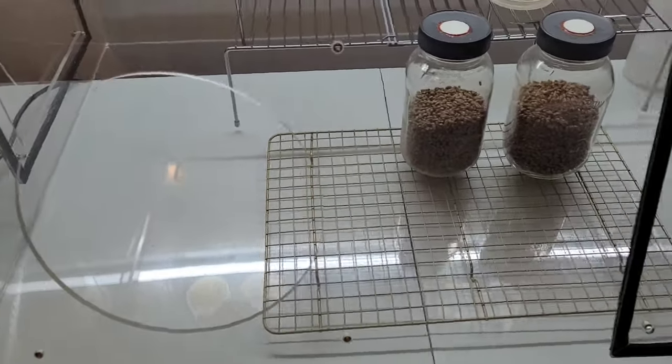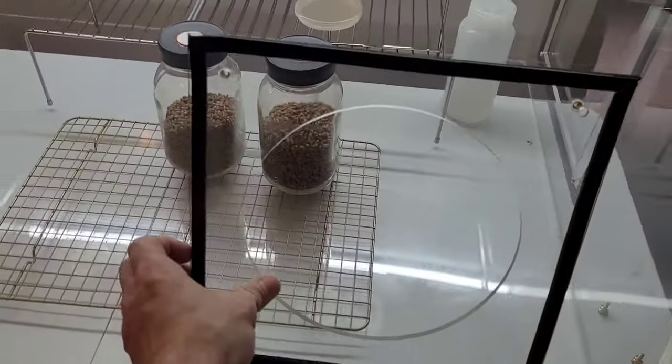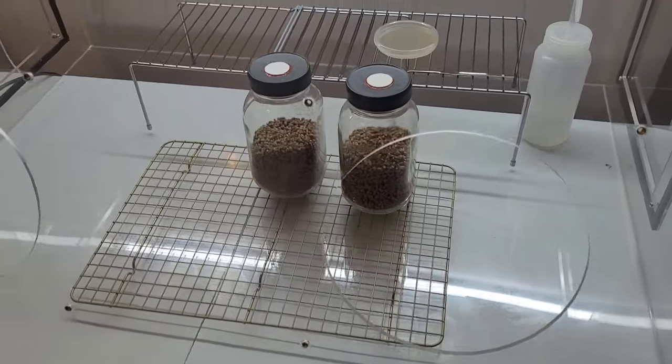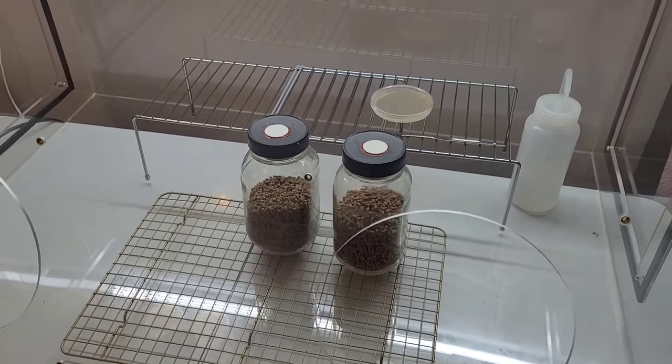Now you're not likely to have armhole covers like mine, however I do recommend covering your holes with something, some sort of flap, in order to maintain a still air environment. Otherwise the particles will remain aloft within your still air box.